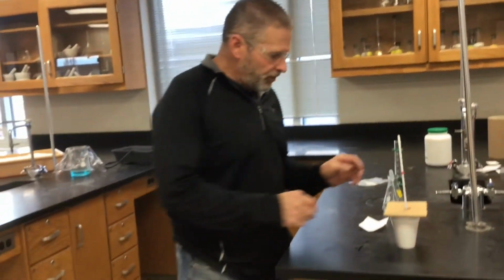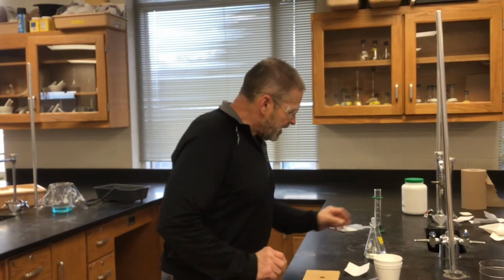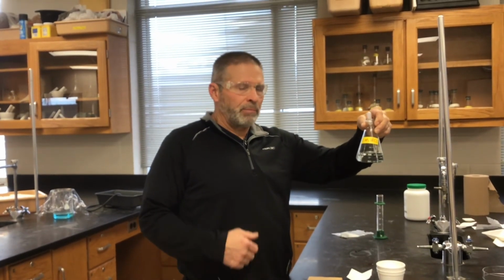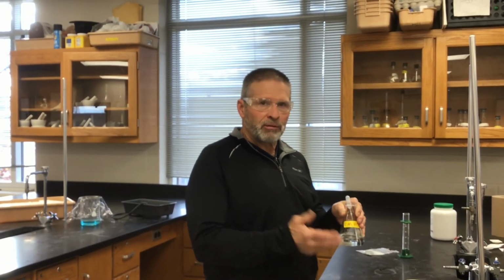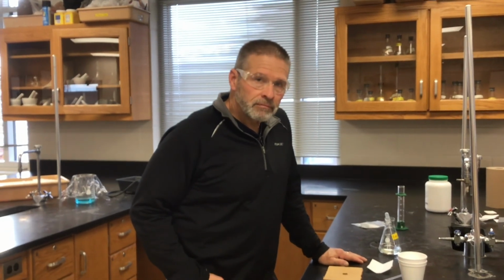Now one final thing to note here, because people get confused on this every year. This HCl solution is almost entirely water. There's a little bit of HCl in there, but it's almost all water. So when you use the Q equals MC delta T equation, you need a mass. Just pretend that this is pure water. We measured out 50 milliliters, so you should be able to figure out the mass of 50 milliliters of water. So we're going to try to find the experimental heat of formation of magnesium oxide. Good luck.